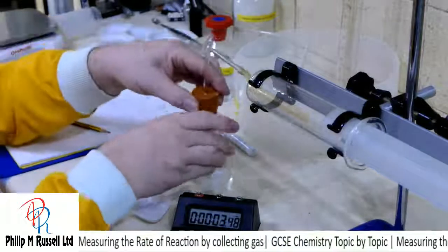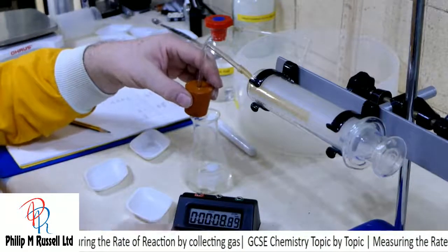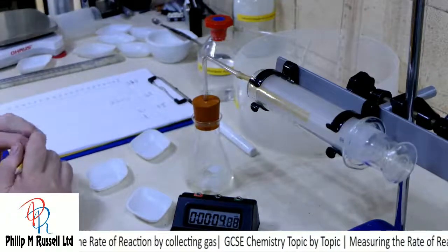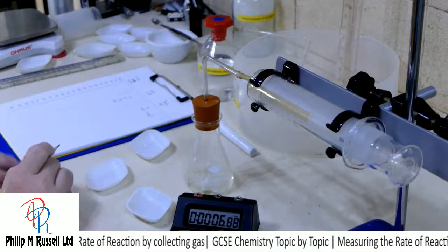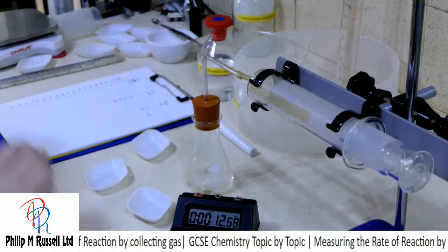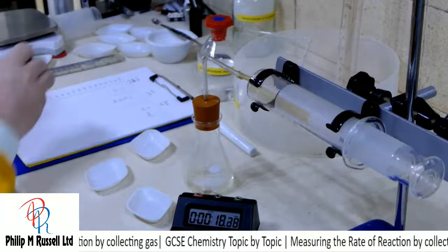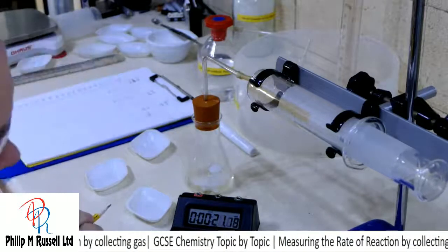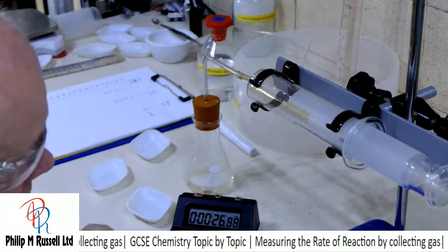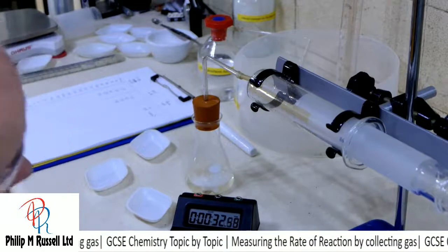And we had a little slight error, we'll do it again. 3, 2, 1, go. Right, so at 5 seconds I've got 18. 10 seconds I've got 31. 15 seconds I've got 41. 20 seconds I've got about 52. 25 seconds we had 61. 30 seconds I've got 71.